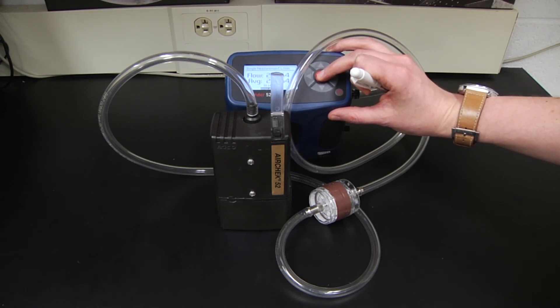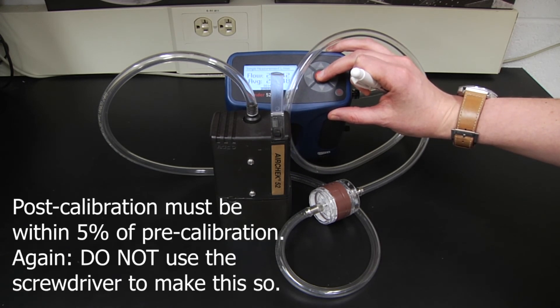Take at least three consecutive samples and verify that your post-sampling calibration is within plus or minus 5% of your pre-sampling calibration value.